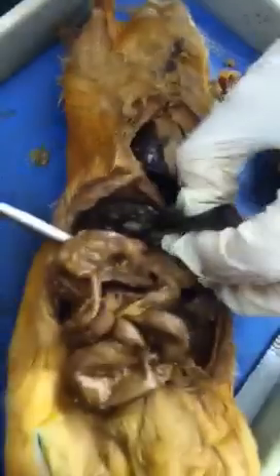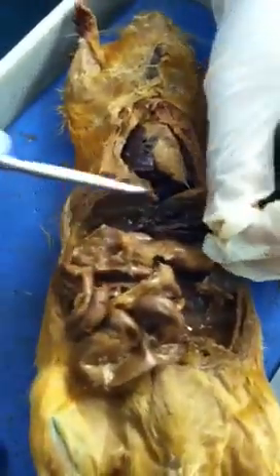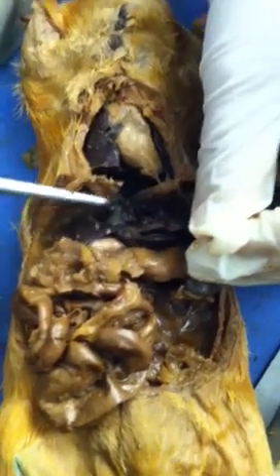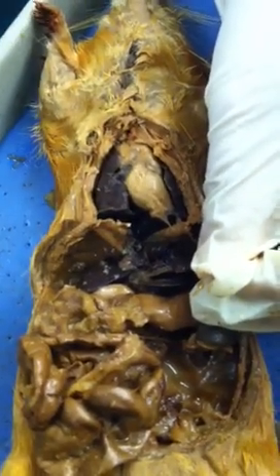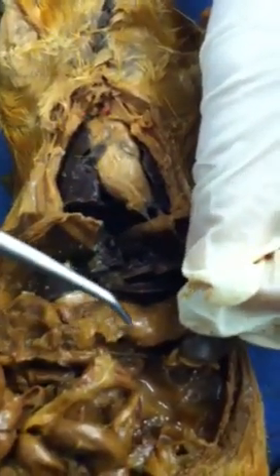Now let me remove the liver so I can expose the bottom to show you. If I expose this area more, you will see a tubular structure actually going through the diaphragm — that structure right here is actually the esophagus. Food goes from the mouth, all the way through the esophagus into the stomach.